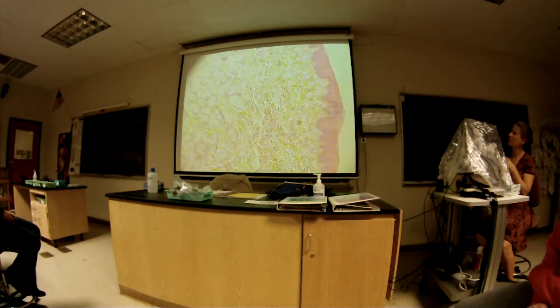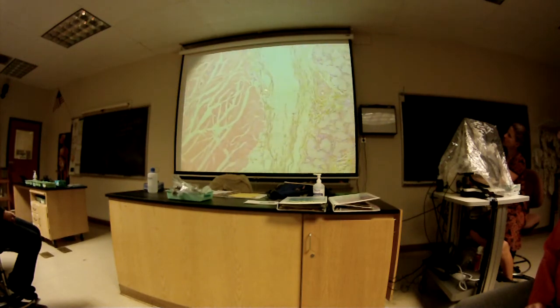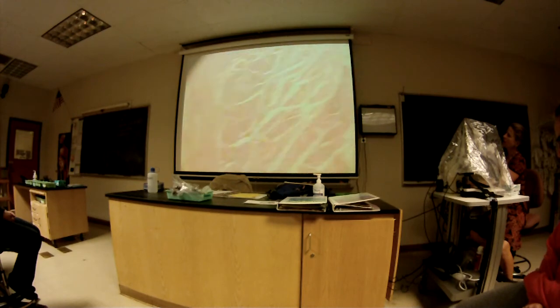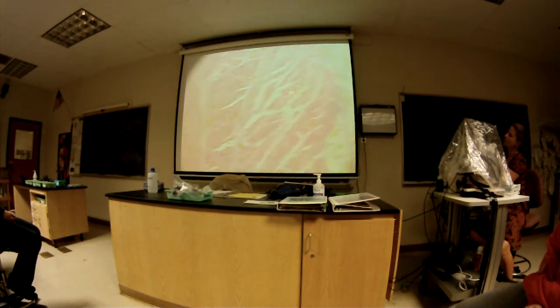And what are these called? Yeah, those are the esophageal glands, right, the mucus. So they're in this main layer. You see it starts about here and goes to about right there. What is that main layer? Submucosa. Yeah, those are esophageal glands. And here's our next main layer, here to there. What's that? Muscular externa. Muscular externa. Good. And how about this one? Adventitia. Good. All right, great.